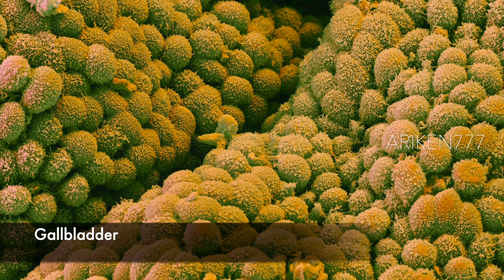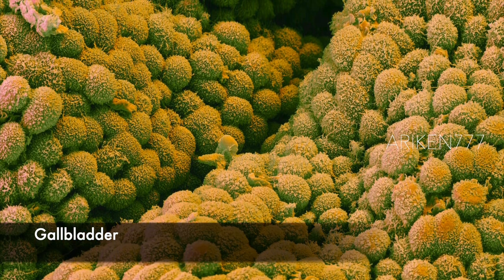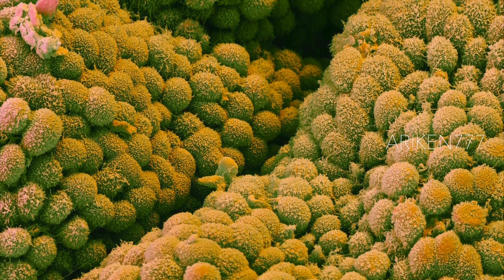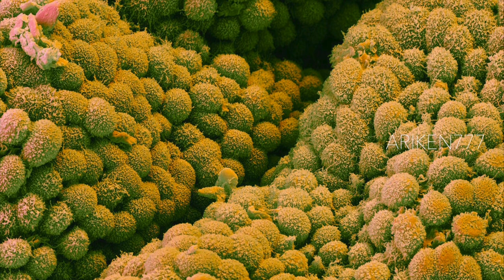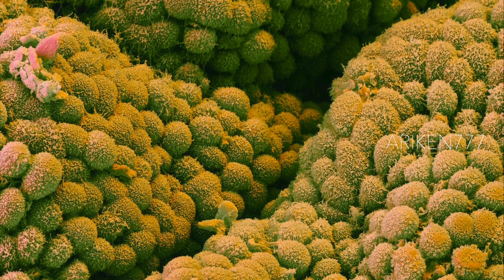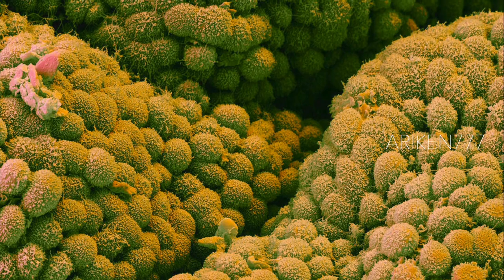The surface of the gallbladder — a pear-shaped sac which stores bile secreted by the liver. This image shows the numerous microvilli that cover the columnar epithelium.